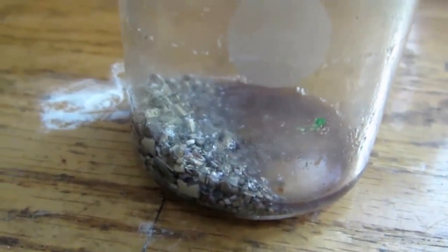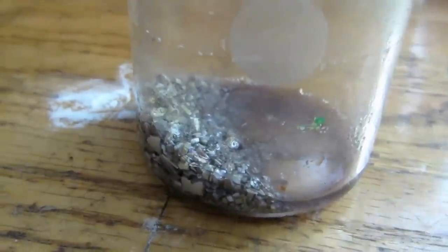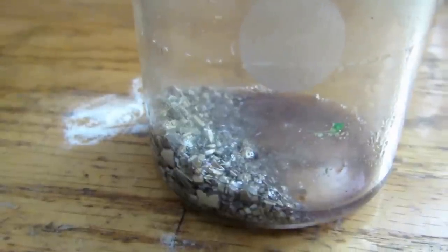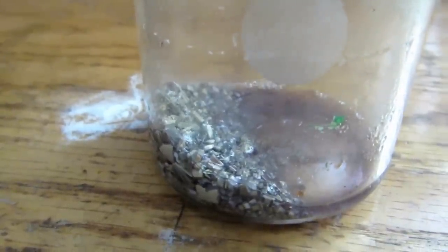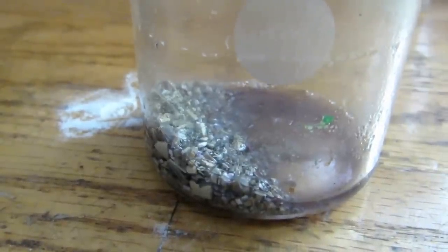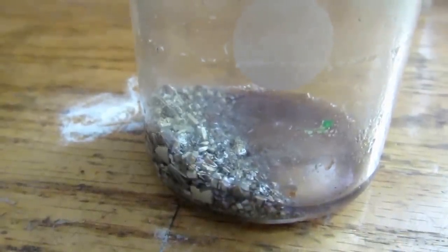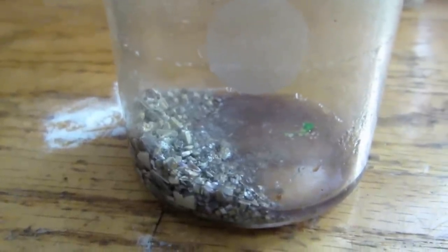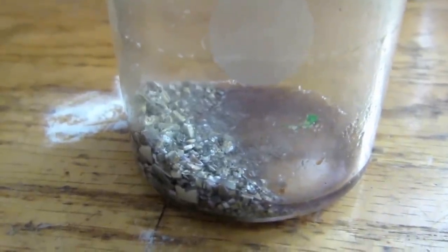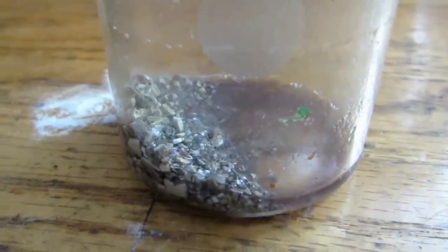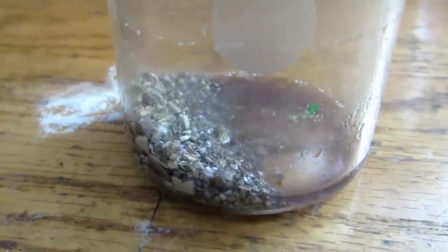So, I'm going to wash this super well. So I'm going to put it in a coffee filter and just rinse it over and over and over and over. Now, it's very important to get all the hydrochloric acid off, because after we're going to be putting in some nitric acid. Now, we made some nitric acid in a previous video, and we just need some weak nitric acid. So you don't have to concentrate what we made previously. And this will dissolve off any of the silver or anything, because we don't want silver in our final product. So, I'll be back once I dissolve this in some nitric acid.